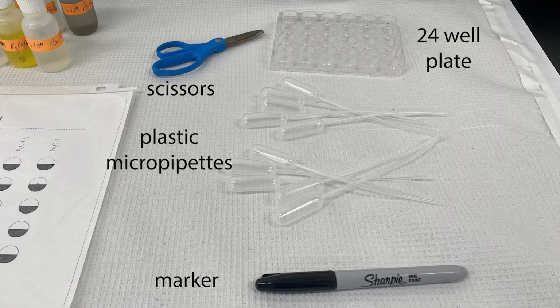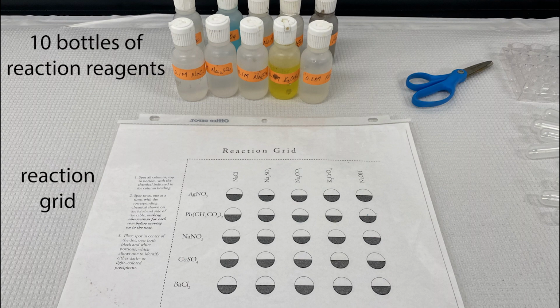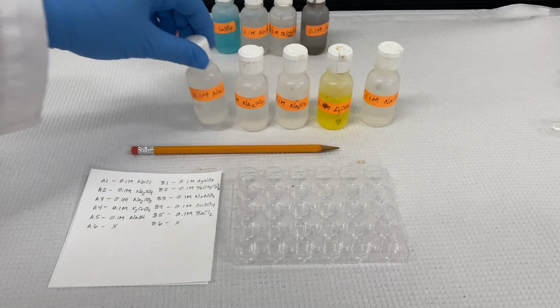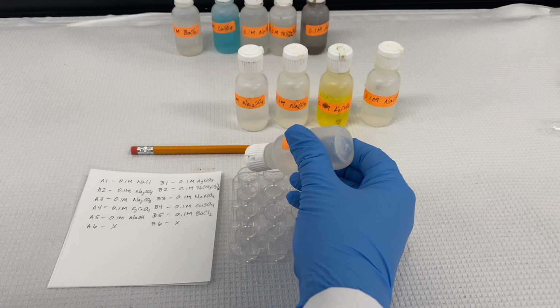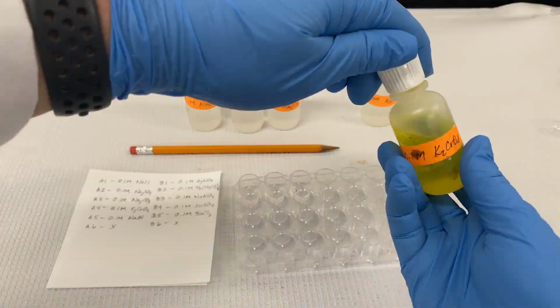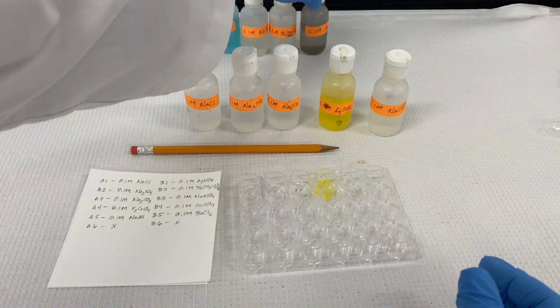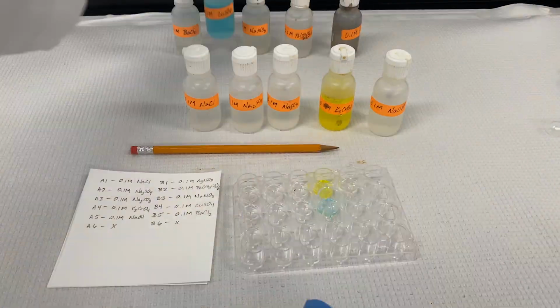You're going to need a number of items shown here, and a reaction grid. This particular reaction grid has been cleaned and a final rinse with DI water. We're going to have 10 reagents that we're going to use, and the first thing we're going to do is use a well plate. We're going to get us a small stash of each of those for use later. First chemical is put in well number A1, and then the next in A2, and so on until we have samples of each of the 10 reagents we're going to use.